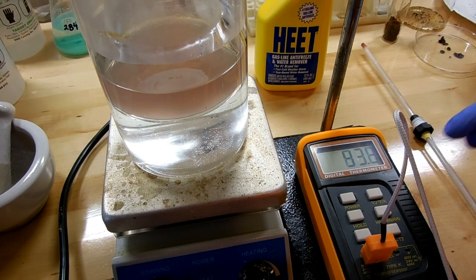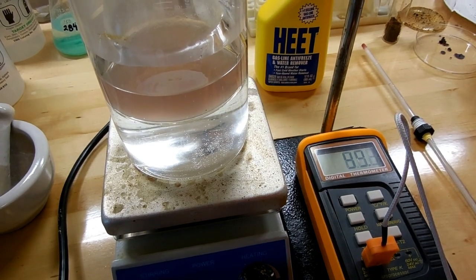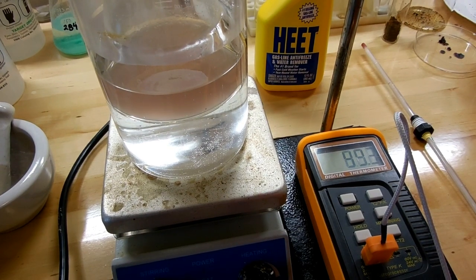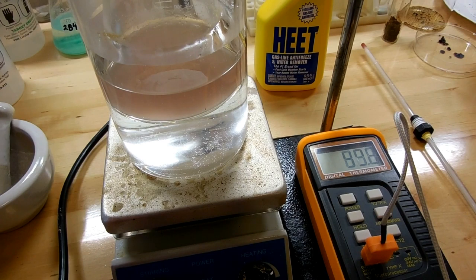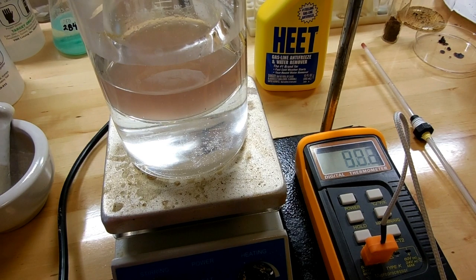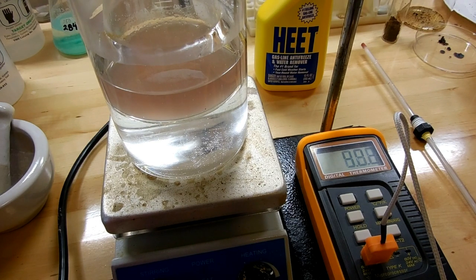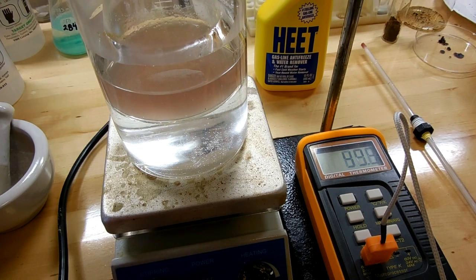You can see the readout on the thermocouple over here. We'll maintain that at 60 celsius. Ideally you would want to use a reflux setup for this but I didn't want to go through all the trouble of getting my water pump and all that equipment out. I've done it before with this setup and it does work.